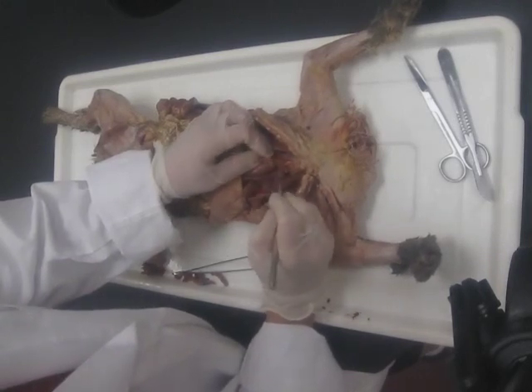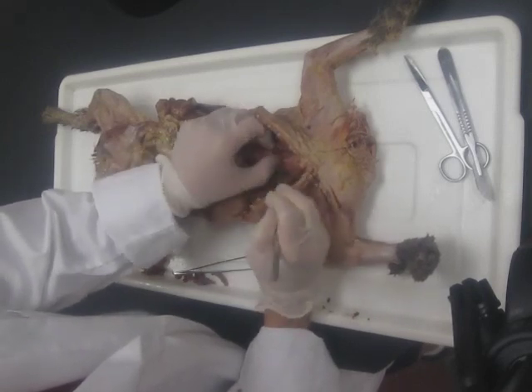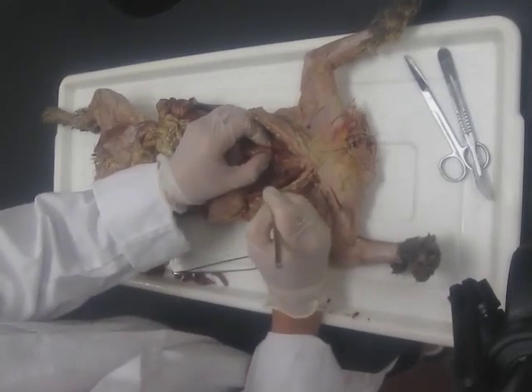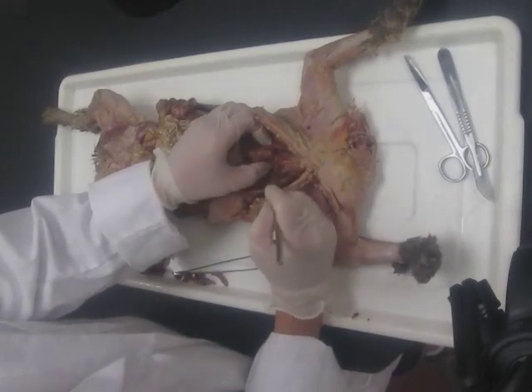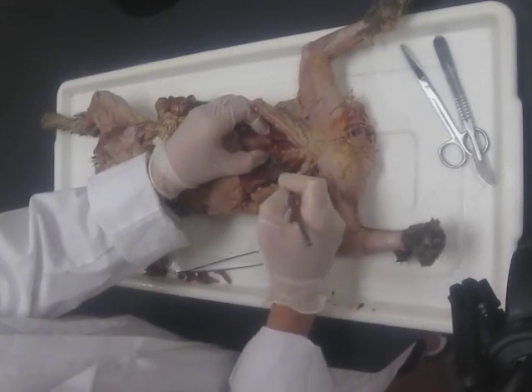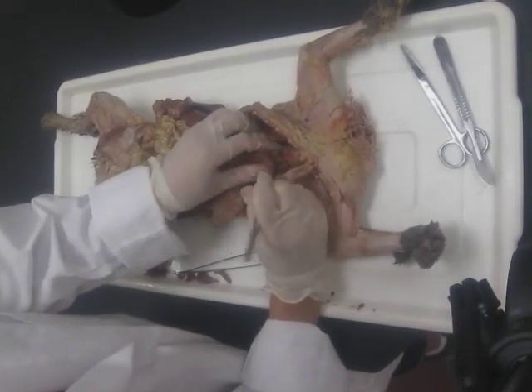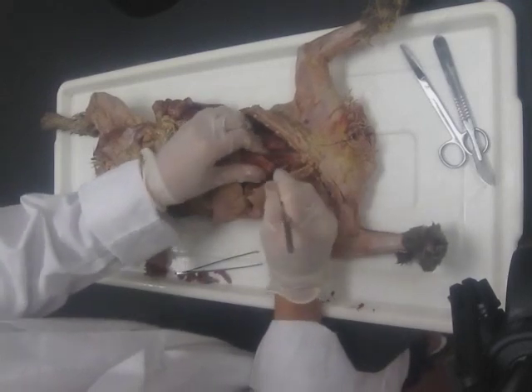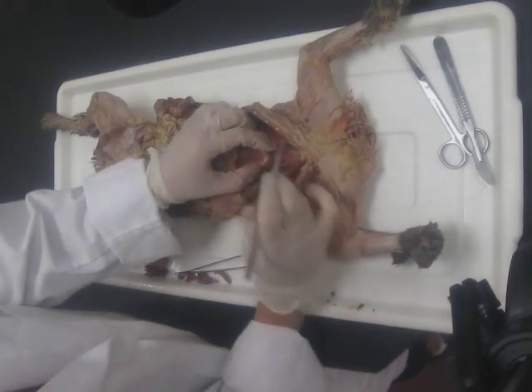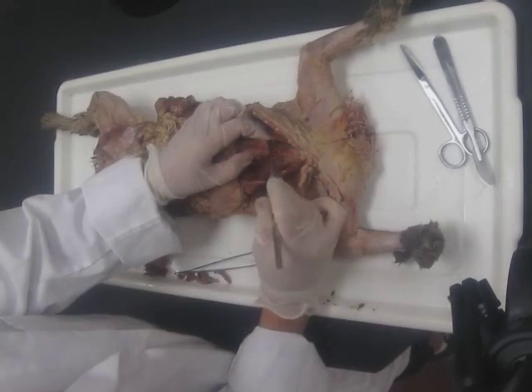The aorta is going to leave the top of the heart — blood goes up, then over, then down. Here is part of the arch down here; it's going over and eventually will go down behind the heart and become the descending aorta. We just need to come over here, keep moving this fibrous sac away from the heart, and find where the aorta comes out the top of the heart. And here it is — usually right behind that fat blob. So this is coming up, over, down — our aortic arch right there.